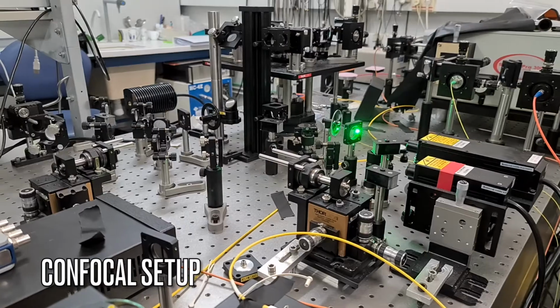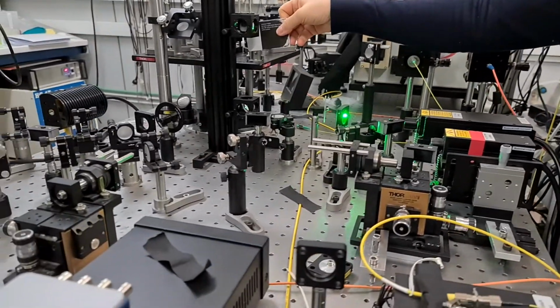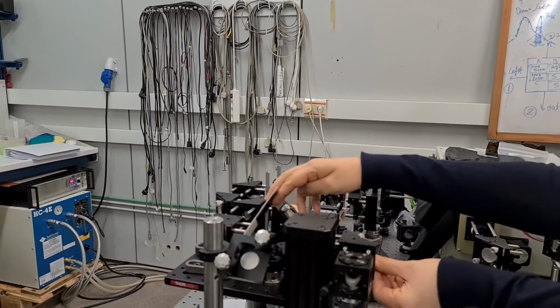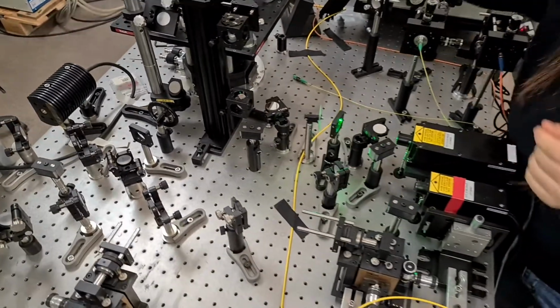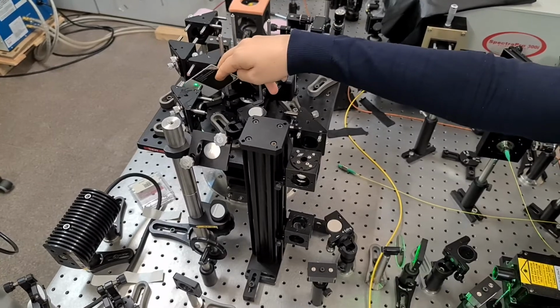Here, the optical setup is similar to the previous one, with steady-state and transient studies, but using confocal conditions for photoluminescence excitation and detection, in such a way that we can investigate small nanocrystals or two-dimensional nanosheets of perovskite, for instance. Furthermore, the cryostat used here is vibration-free, which is suitable for the study of nanoscale materials.